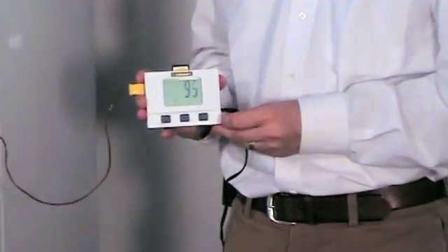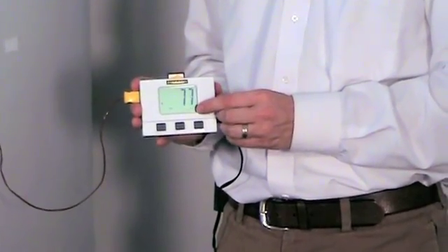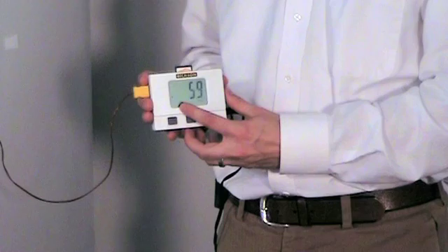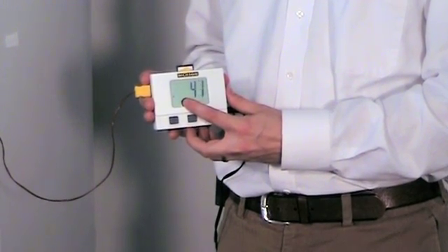Notice the unit counts backwards from 100 and store shows up on the display.